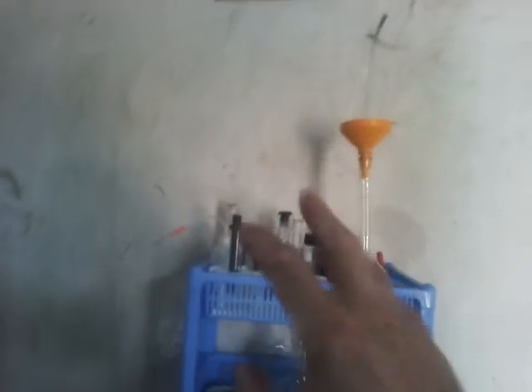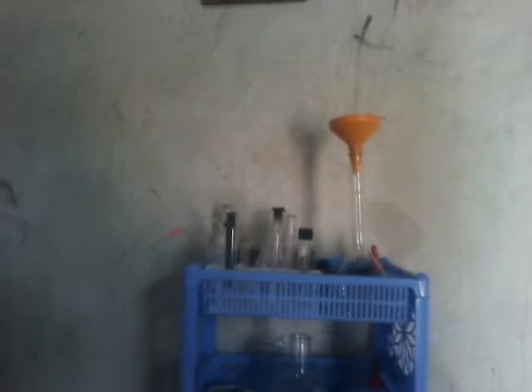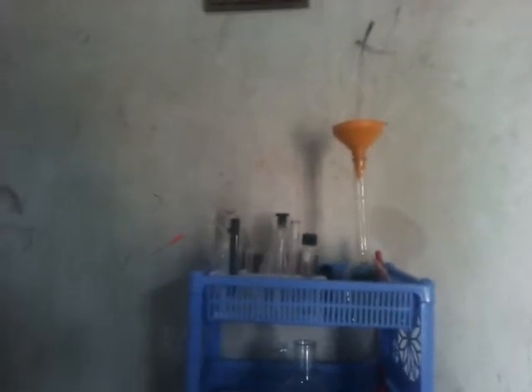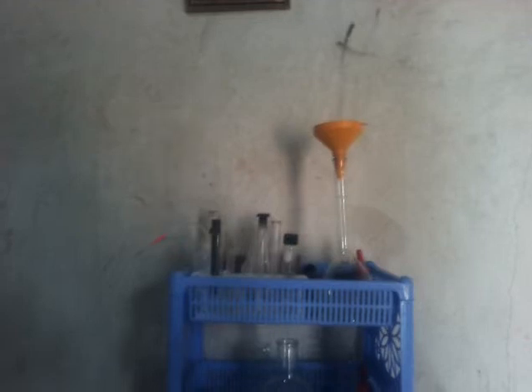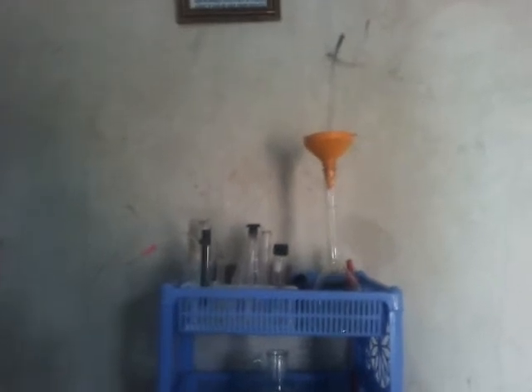The tricky part is going to be taking the table concentrates that I have and using the same process to dissolve the gold out of them. There's other iron, manganese, arsenic, and all other things that react differently, so being able to pre-treat that material — remove the iron, neutralize the sulfides, or at least break the sulfide bond with the gold — so that it can be absorbed in the leach.